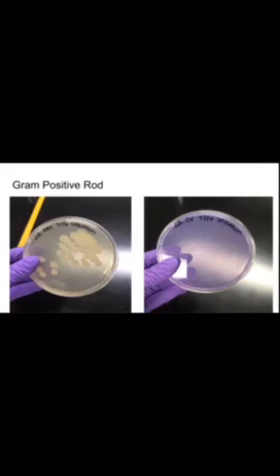I decided to use selective media plates to isolate my unknown. I inoculated a phenyl ethyl alcohol and crystal violet plate to once and for all distinguish between gram-negative and gram-positive. After 24 hours, success. The crystal violet plate showed no growth and the PEA plate had clear, abundant growth.